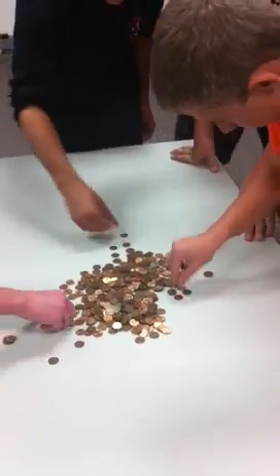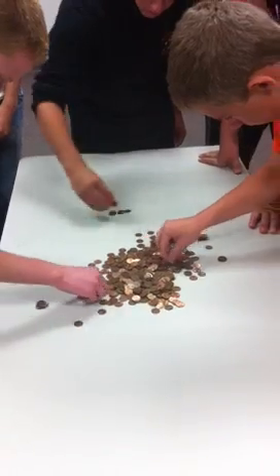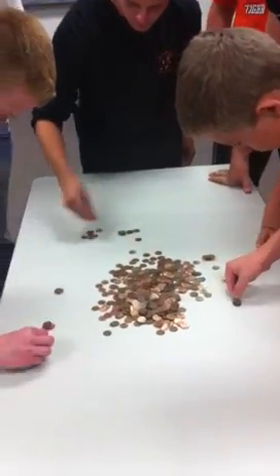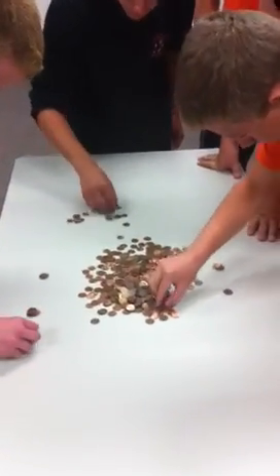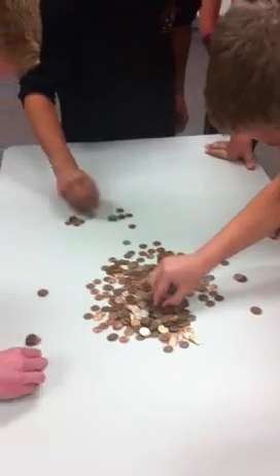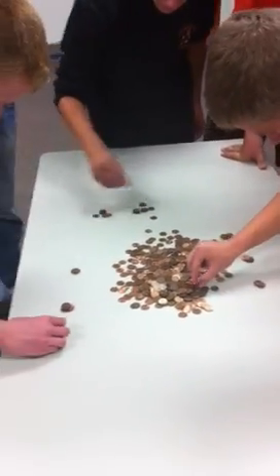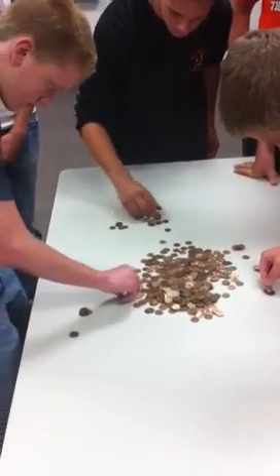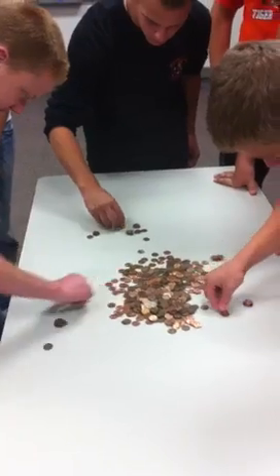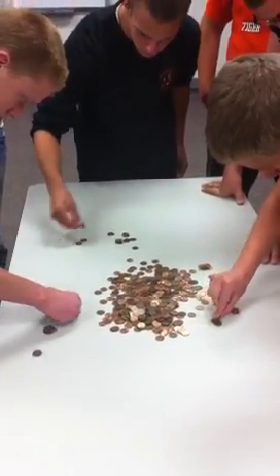Let's go, JJ. Every 10 seconds we call a new stack so that we can keep them organized and we can see the time. The data table, which you guys have all spent some time doing, puts that together and we can graph it out over those 10-second intervals.